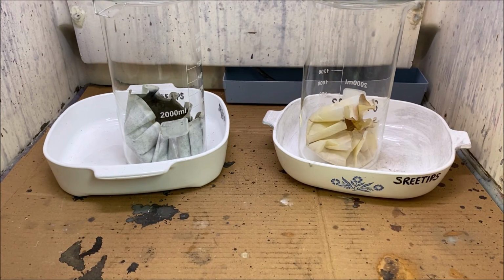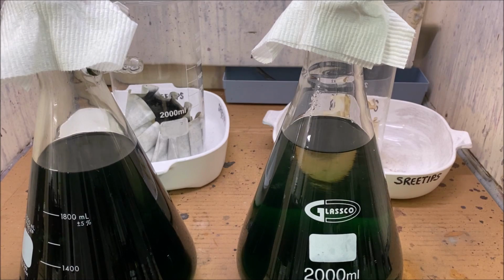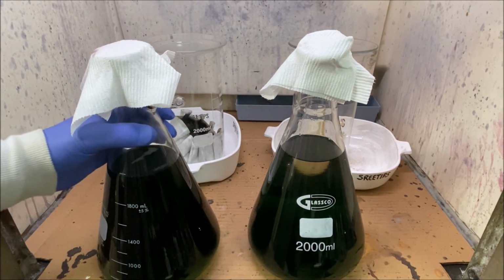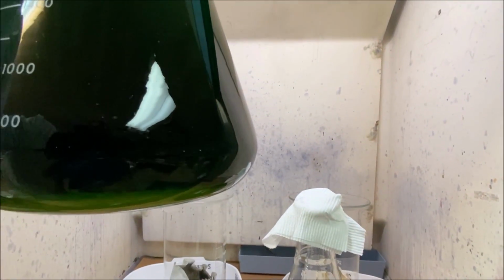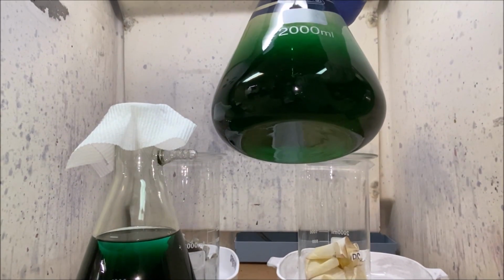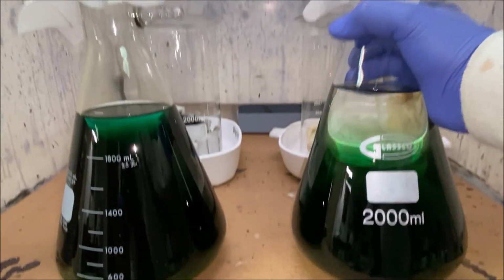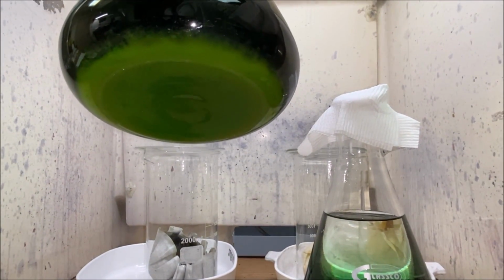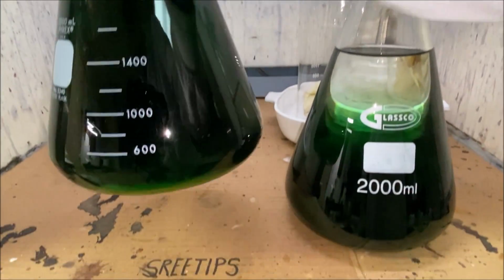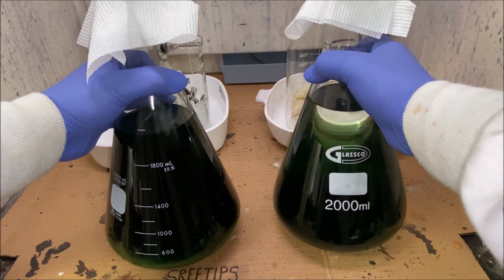Before we proceed, I wanted to give an update here. Someone in the comment section for part 3 made a remark about some precipitate settling out after I allowed it to settle overnight, and that's what's happened in here. In this one, you can see I don't have much in there, maybe a little, but in this one there is quite a bit of precipitate that has formed, so we're going to have to refilter this now. I'll have to filter both of these solutions again to get that precipitate out. I'm not going to do that on camera.